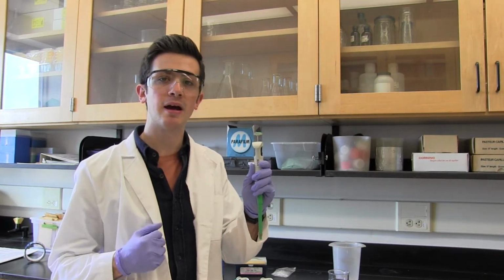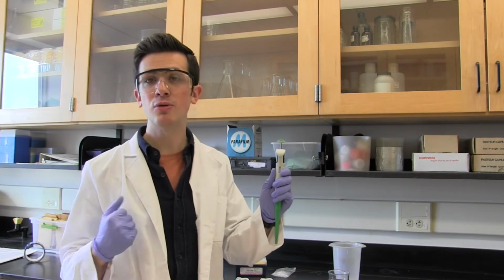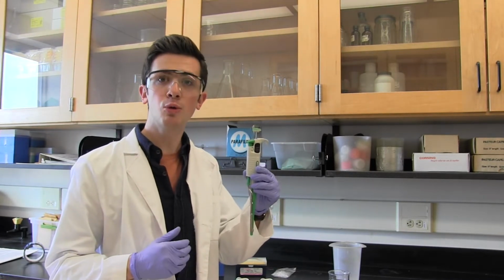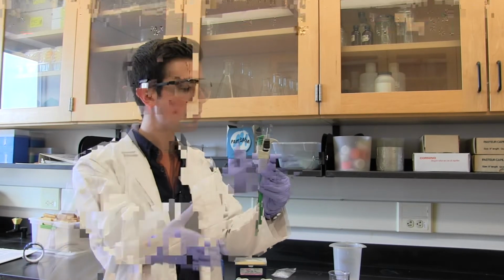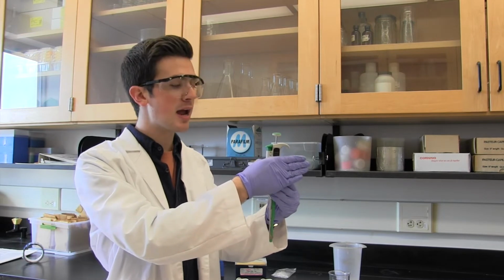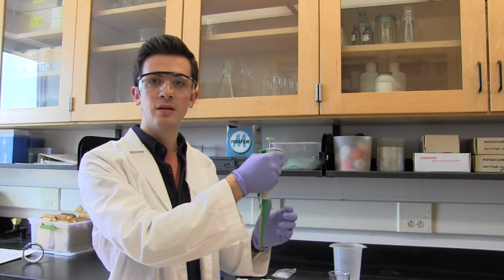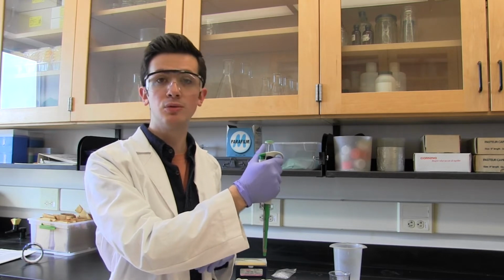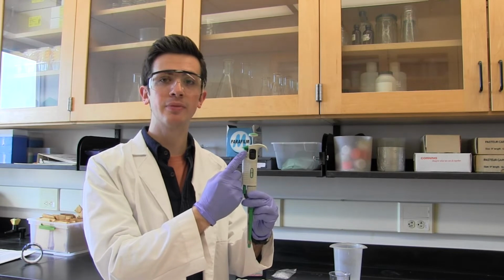So once you set your pipette, you're going to want to raise that lock back up into position to make sure that you don't accidentally change it during experimentation. Now we're ready to use our pipette. You're going to want to make sure you're holding it the right way. So lay your hand along the side of the pipette and wrap your fingers underneath the pipette lip. This gives you a firm hold on the pipette and prevents it from slipping. It also, more importantly, gives your thumb easy access to both the green ejector and the green plunger.